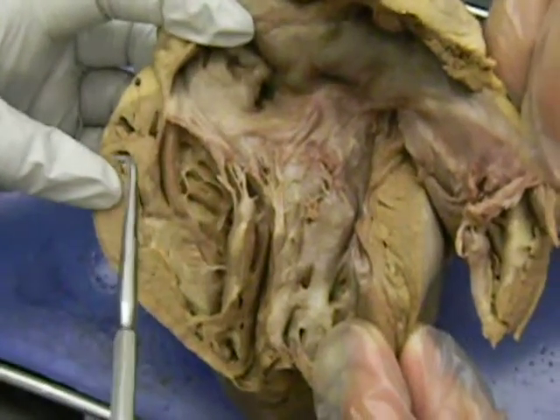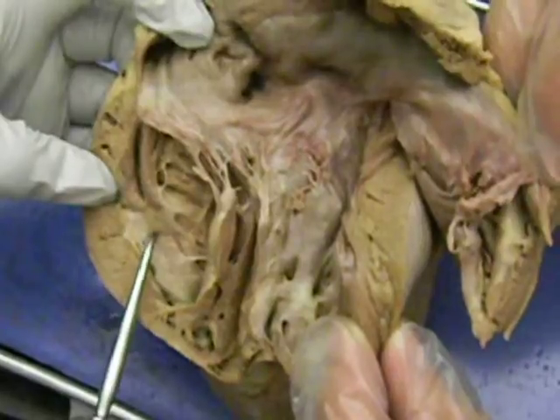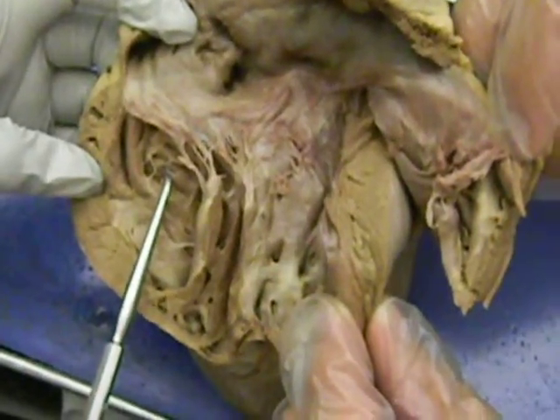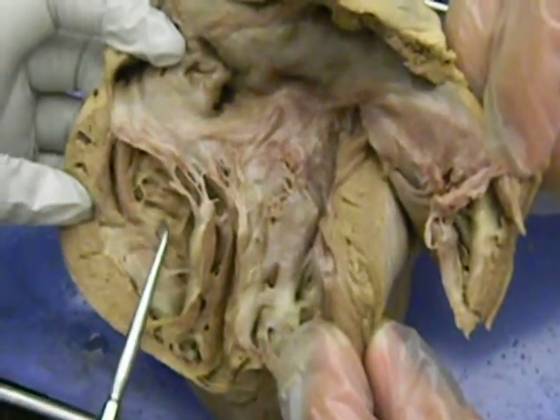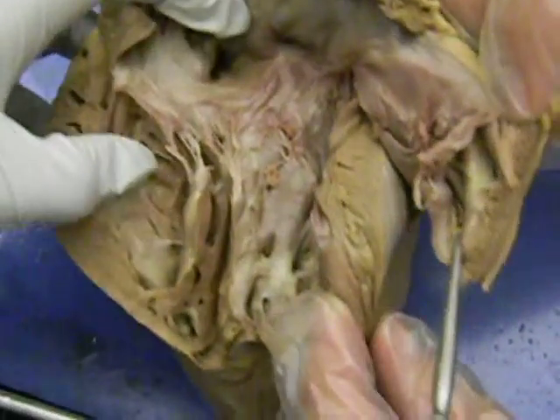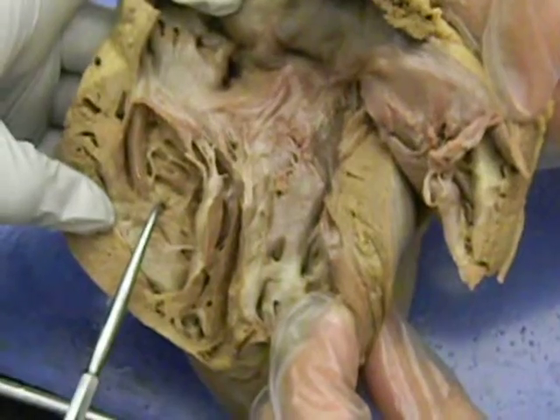Okay, so either left or right, you should have the parts. The outer one is the epicardium, the middle one is the myocardium, the inner one is the endocardium. Now, if the question is tissue, that is the trabeculae carneae. If the question is chamber, then your answer is right ventricle. Okay, so if it is layers, then epi, myo, endo. If it is a tissue, the name of the specific part.